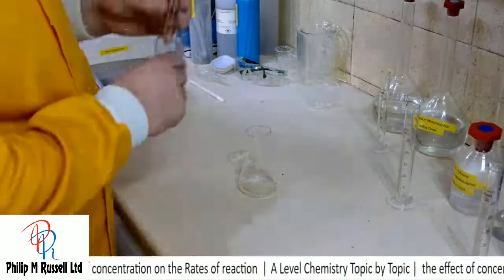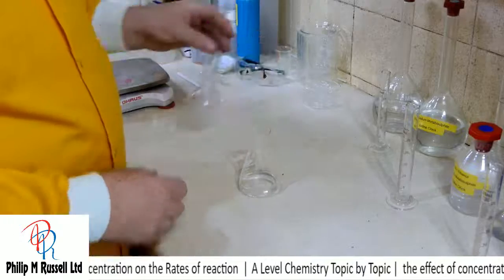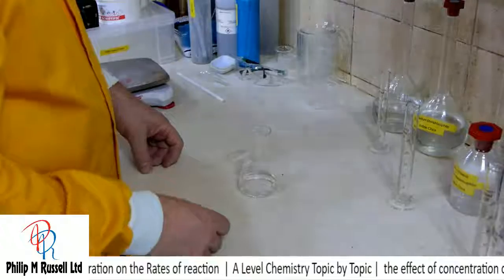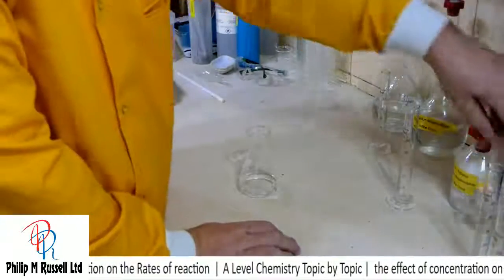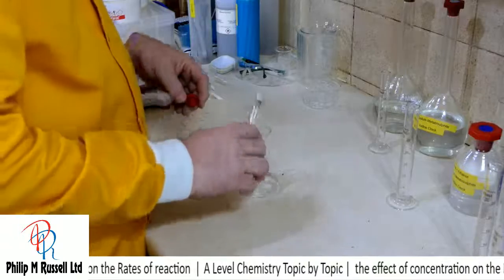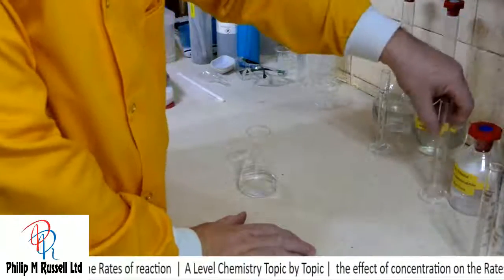I'm just going to put in about 25 mils of water. We'll do a more accurate version a little bit later. Now to this I want to put in a little bit of starch indicator. There we are. As you see, it's a little bit of bucket chemistry going on here.